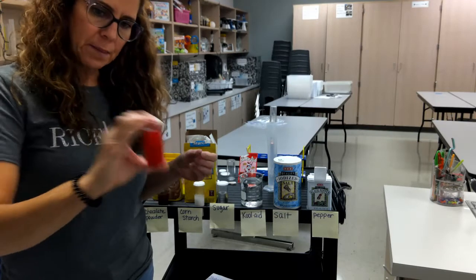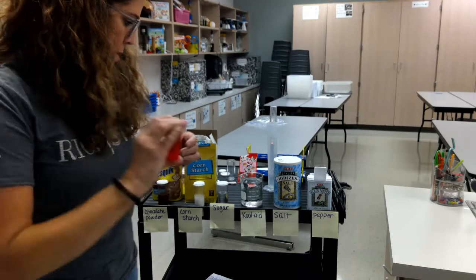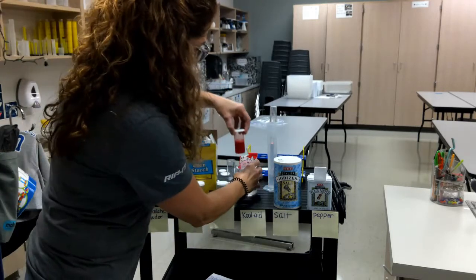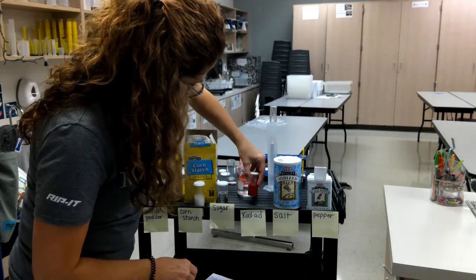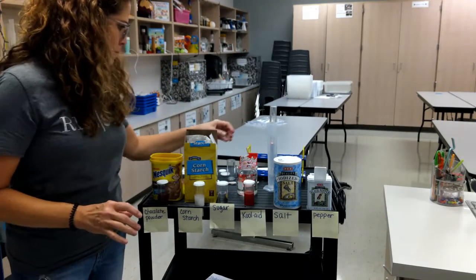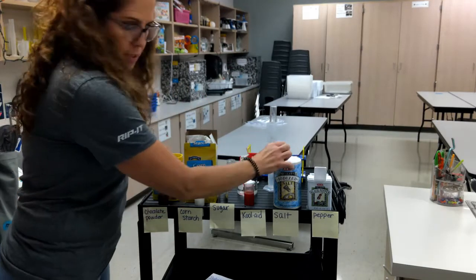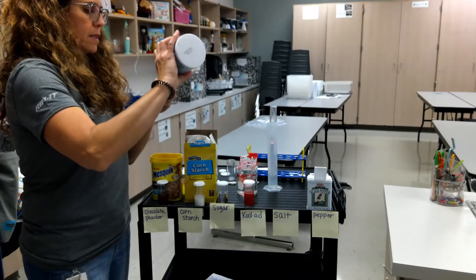Okay, we're going to shake it up, agitate it, and we're going to let this sit. Okay, moving on to our salt. What did you say about salt? What was your prediction? I'm going to add some salt in here.